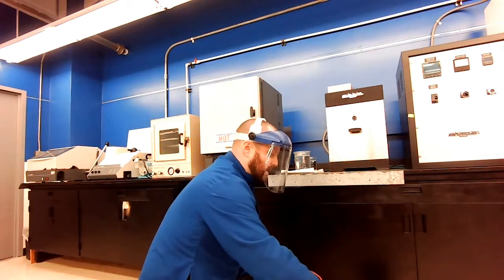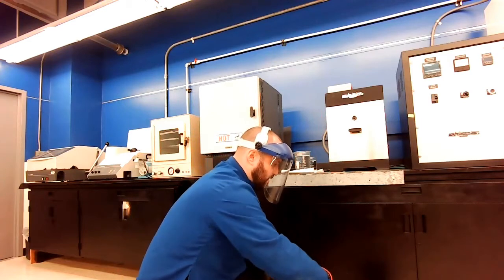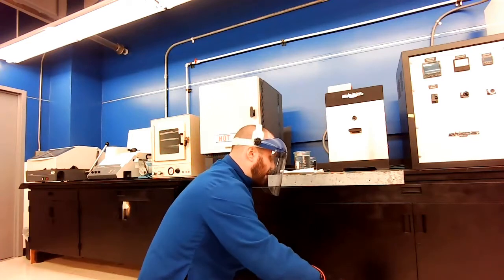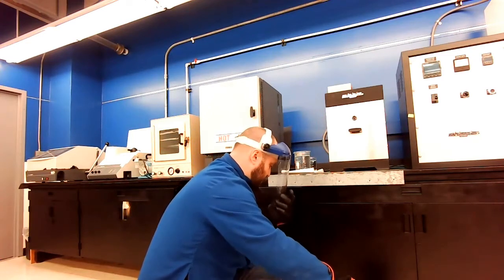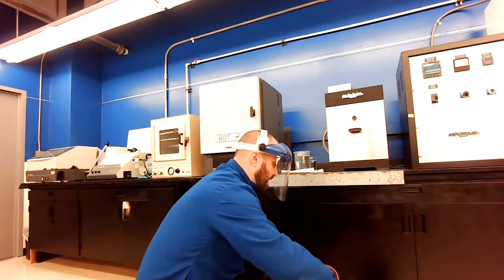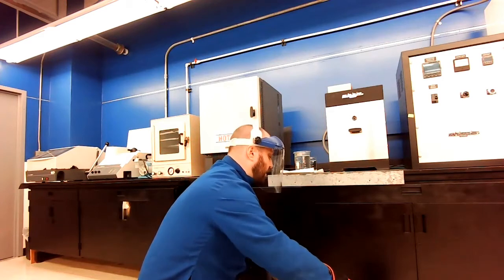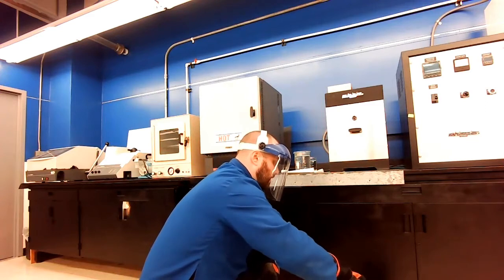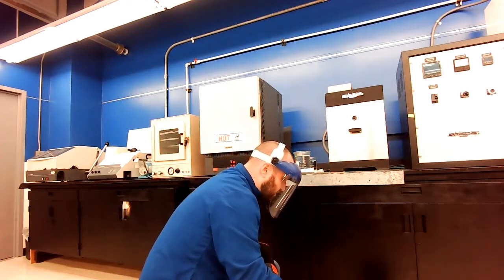So I'm not sure if you guys can hear it, but when I put this sample into the cool water, I hear a whoosh as that vapor layer is first made, as a sign that that water is reacting to my very hot sample. Again, these are glowing hot, very, very warm. I'm stirring it around, moving in a figure eight pattern, trying to keep those bubbles off.